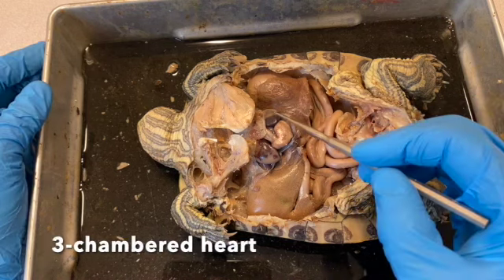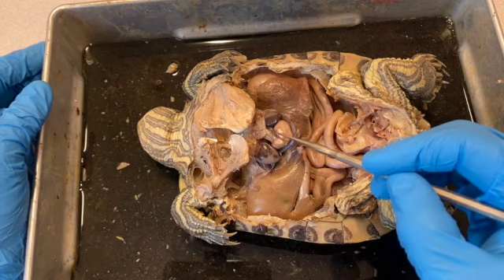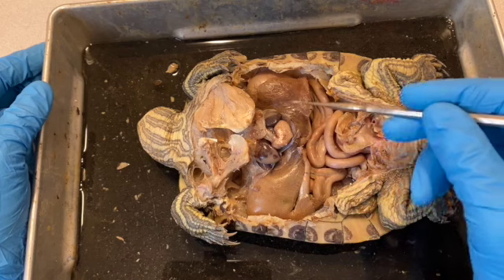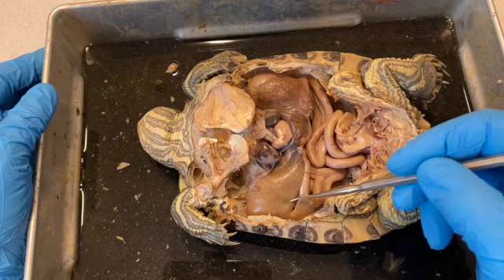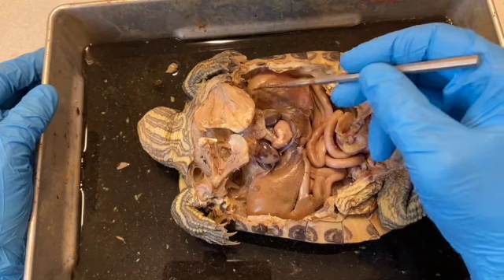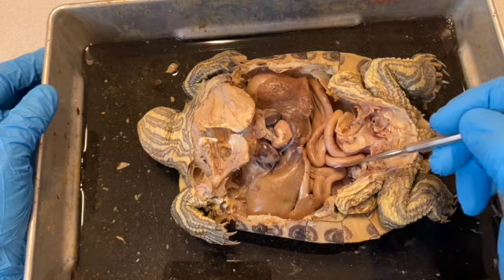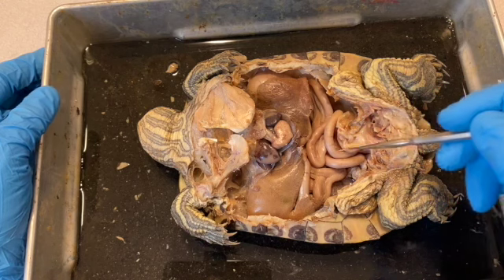This is the pericardial cavity wall right here, and inside we have the heart. So we have a pair of atria, one ventricle, and then we have vessels coming and going from the ventricle. We'll look at those in more detail later on. These large lobes here are the liver, and there's a slight discoloration. The gallbladder is going to be down in here. We'll take a look at that later on as well.